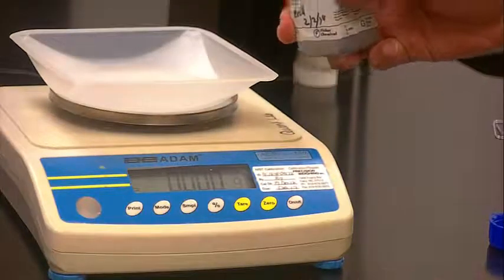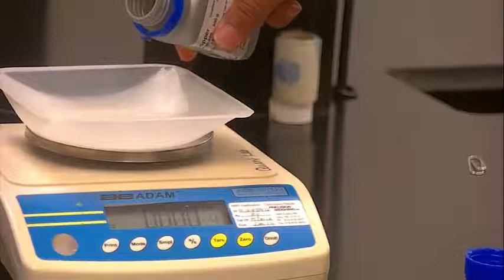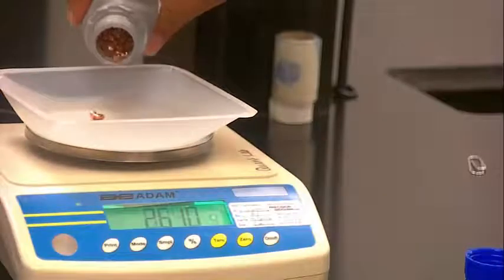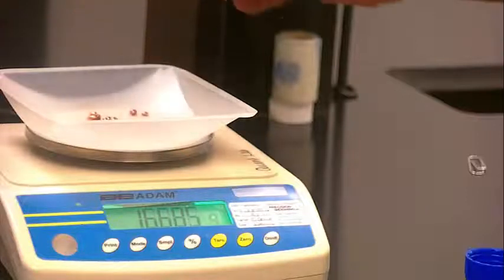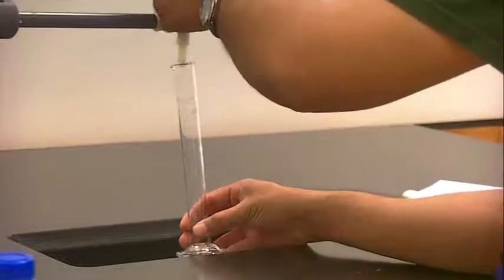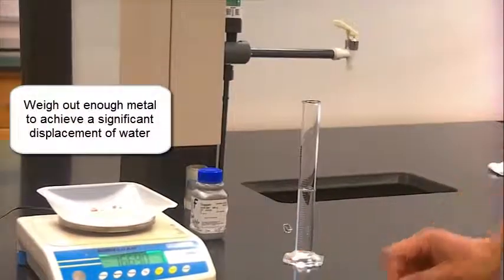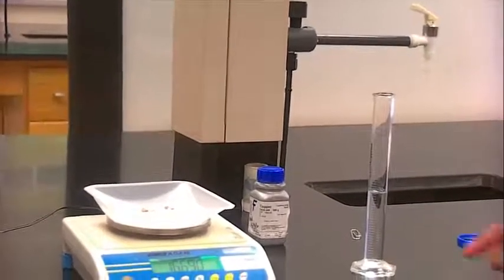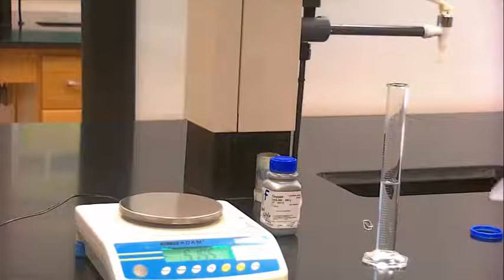Now, how much do you want to weigh out? Probably 15 to 20 grams, maybe 10 grams. But I'll just go and have a happy medium and say 15. So it's at 0.00 tared. I'll go with about 16.690 grams of copper. So I'll get my volume. Let's just put water here. So 16.690 grams. And I have about 29.0 mL of water. Okay, remember, record this volume to 1 decimal point. And now I'm going to measure the volume displacement. Okay, so 16.690, 29 mL.